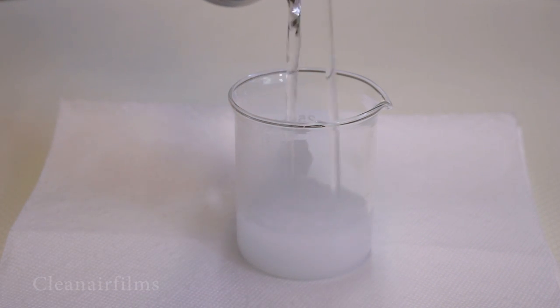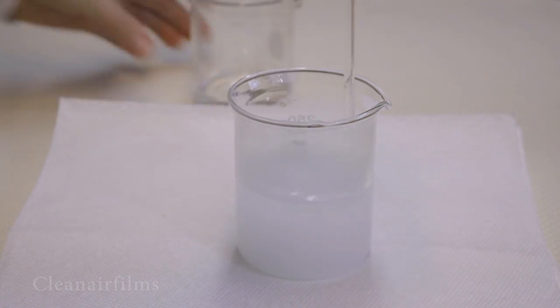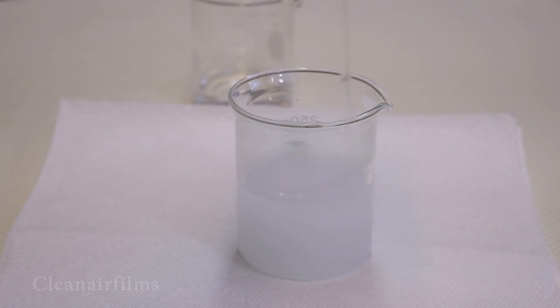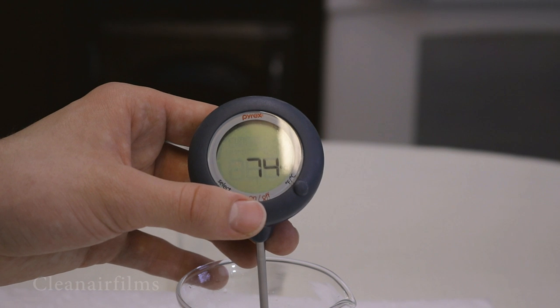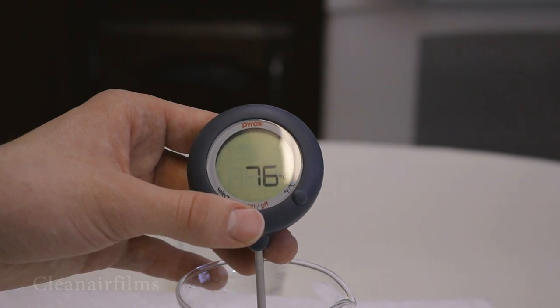Use the stirring rod to mix the lye and water together. Stir constantly. Now let's see what the temperature is. It is 74 degrees Celsius and rising.